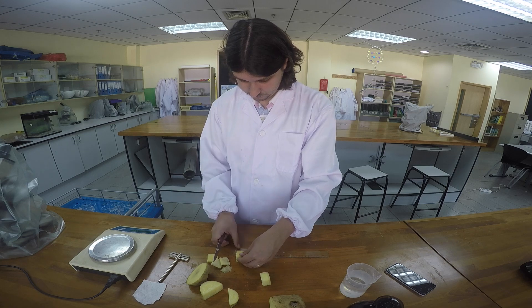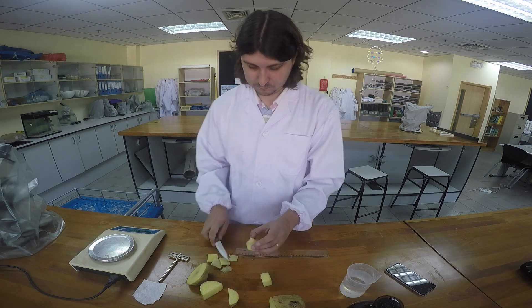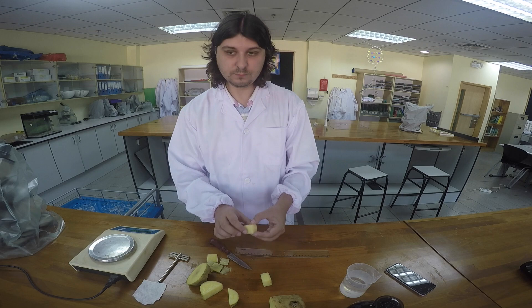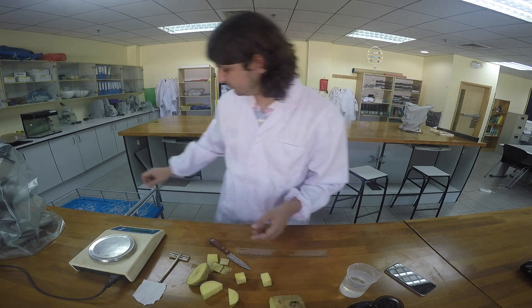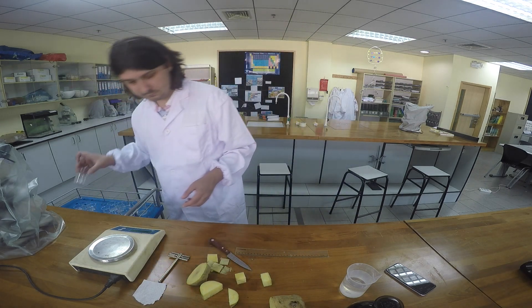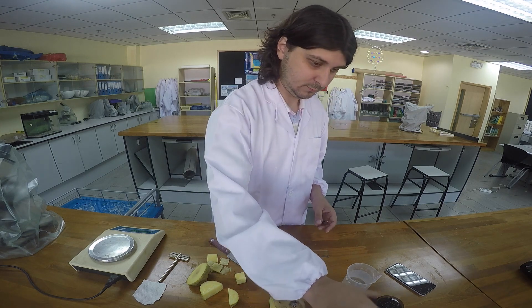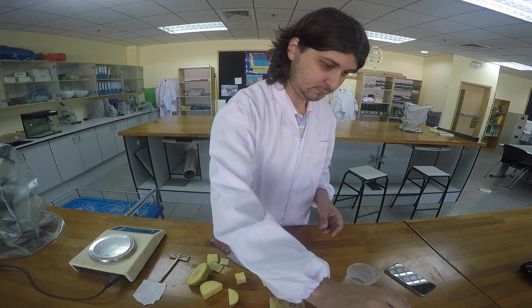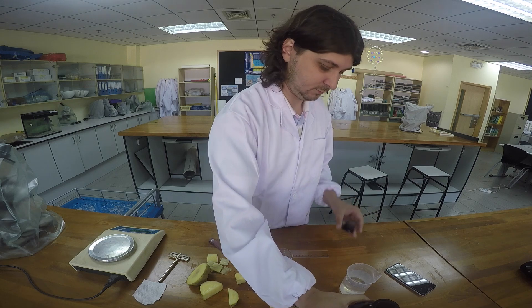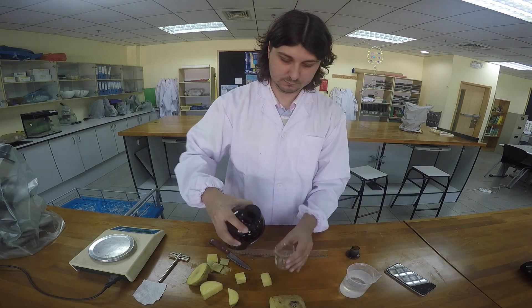Students can then calculate surface area, volume, and the surface area to volume ratio using this information. Once the cubes are cut out, submerge them in large beakers containing iodine. The smaller cubes will comfortably fit in 100 mL beakers, but larger cubes need 200 mL beakers and significantly more iodine.